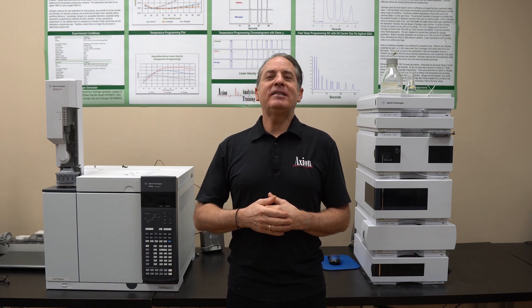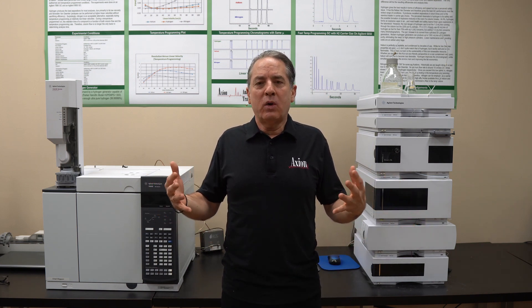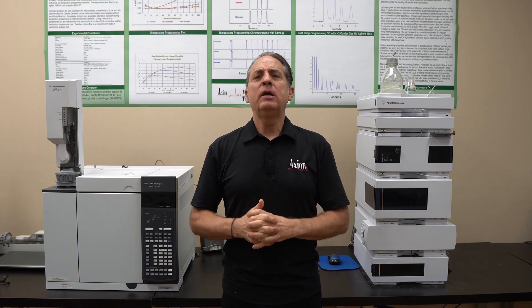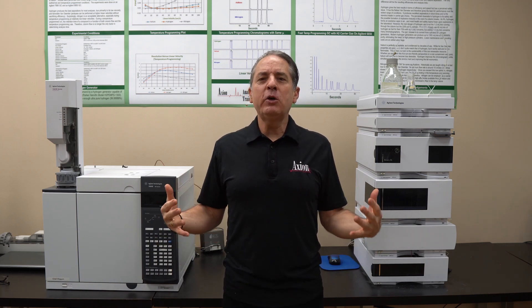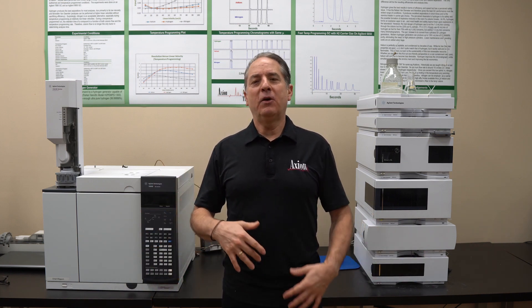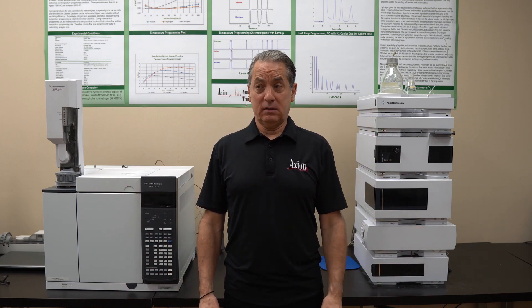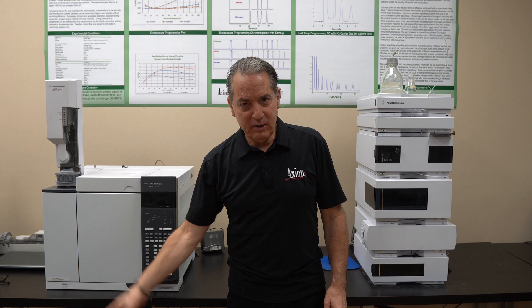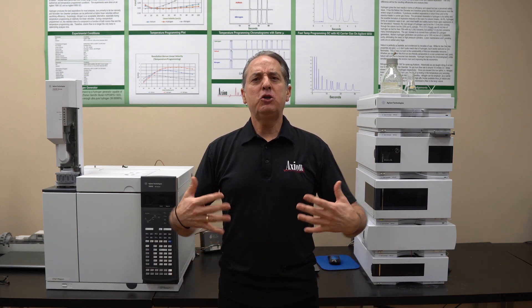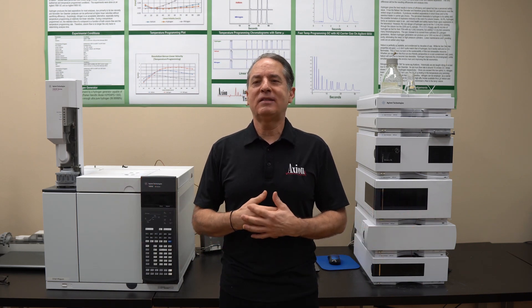Step two, let's develop a method from scratch. Let's say we have a total unknown and no idea of what conditions to use. So the first thing I tell people is choose a really good standard column. In the GC world, we like the DB-5 — 5% phenyl, 95% methyl. Everyone makes one of those. Restek calls it RTX-5, Phenomenex calls it ZB-5, Agilent calls it DB-5. So choose a 5 column — it's our go-to column in the GC world. It separates most things.